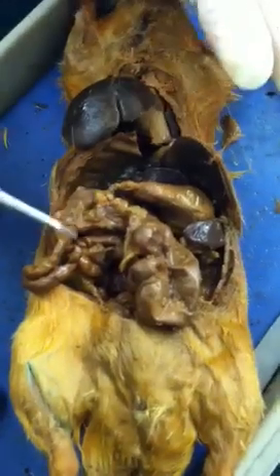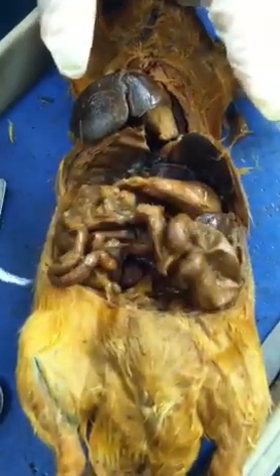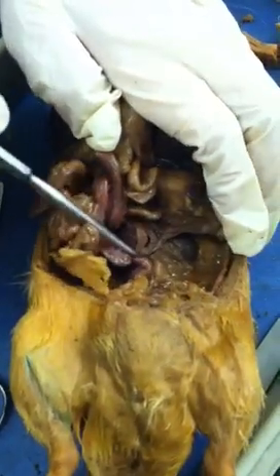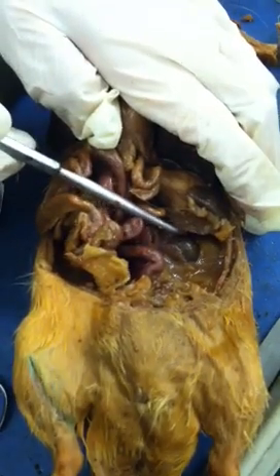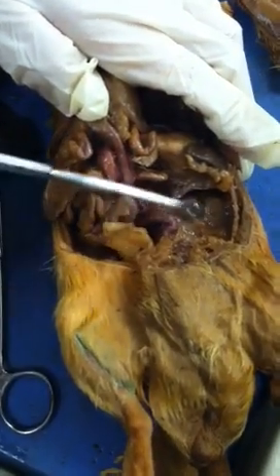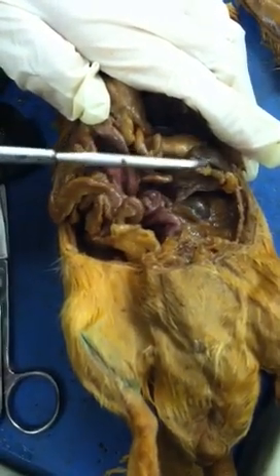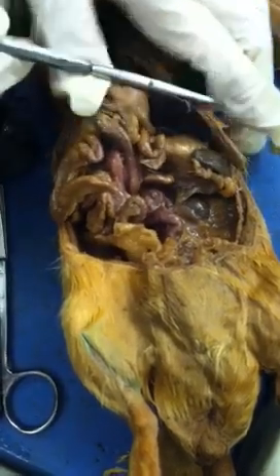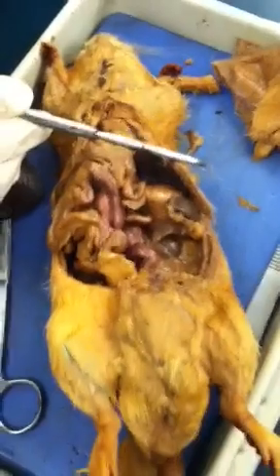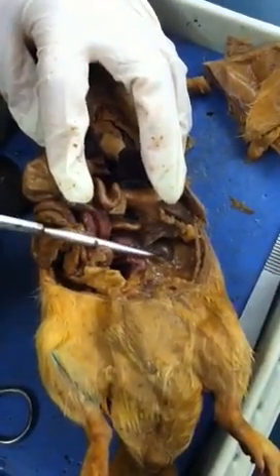Now let's follow downwards — you will see all those intestines. You don't have to know which one is large intestine or small intestine, just know it's intestine. And if I flip everything up, you will see toward the bottom — that's the kidney. Don't confuse kidney with spleen. Spleen originates from the back but folds at the front, while the kidney just attaches to the back.